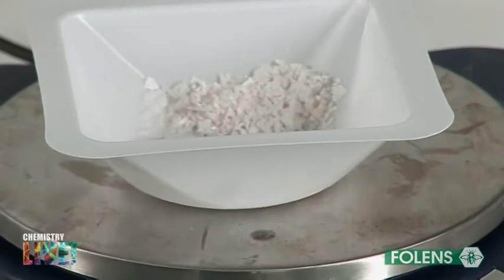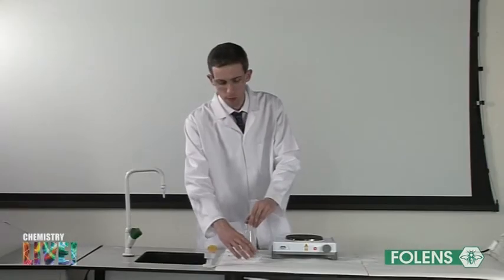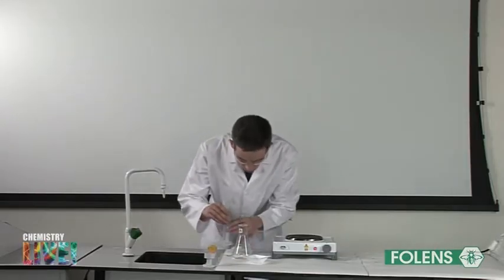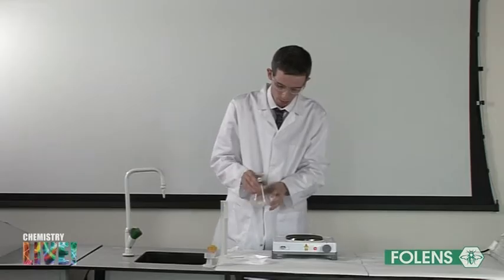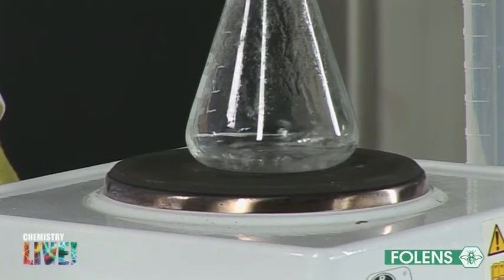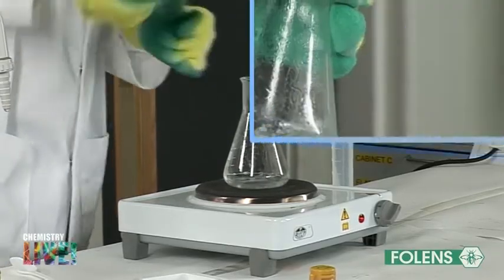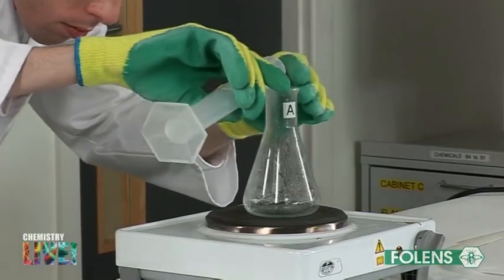The mass of the benzoic acid crystals synthesised in the last experiment is found on the laboratory balance. The crystals are placed in a conical flask, which we will label conical flask A. Using a graduated cylinder, about 10 cm³ of water is added to the conical flask. The conical flask is placed on a hot plate and the water is boiled. While heating, the solution is kept well stirred with a stirring rod. 10 cm³ portions of water are added to the boiling water in conical flask A until the benzoic acid has dissolved.